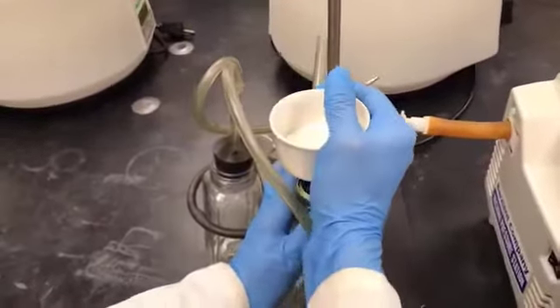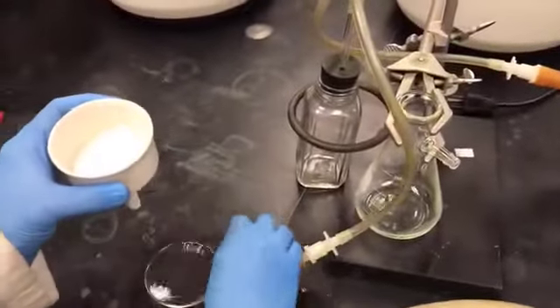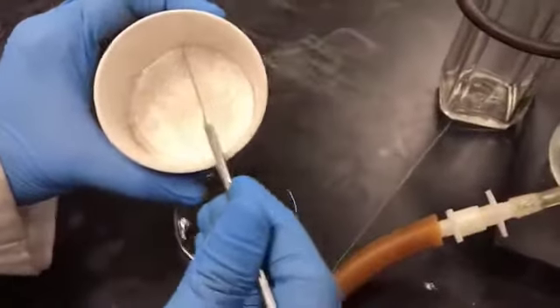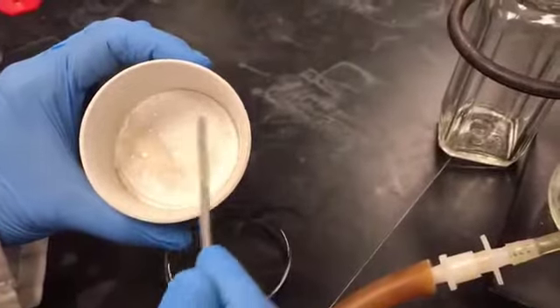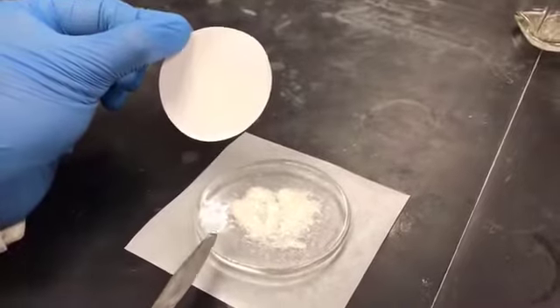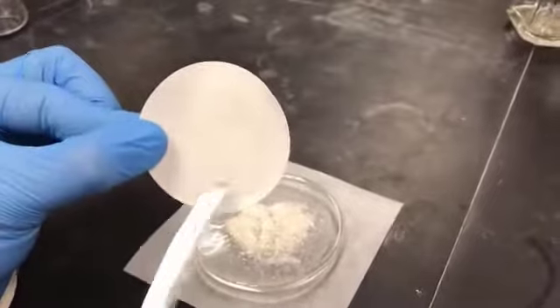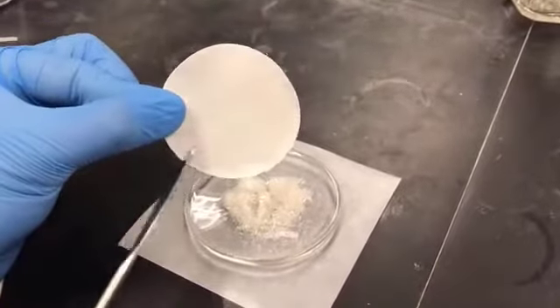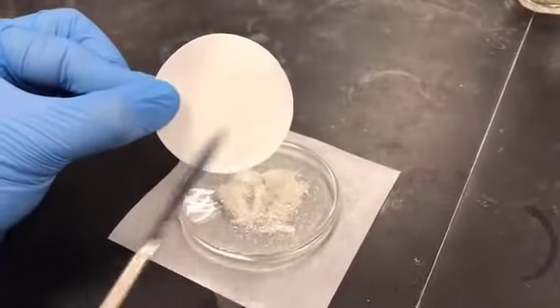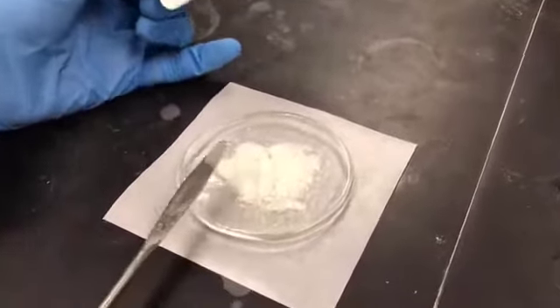Now I will remove the Buchner funnel, and I'm going to transfer all the crystals onto the pre-weighed watch glass. As you can see, I have transferred the maximum of the crystals from the filter paper to the pre-weighed watch glass, and some of the crystals are still stuck to the filter paper. But if I scratch the filter paper more, I will start scratching off the filter paper, and that will add to the weight of the sulfanilamide. So you can see how the crystals look.